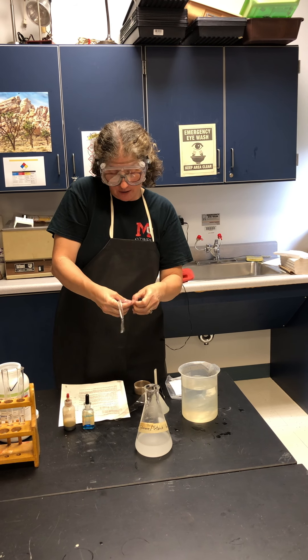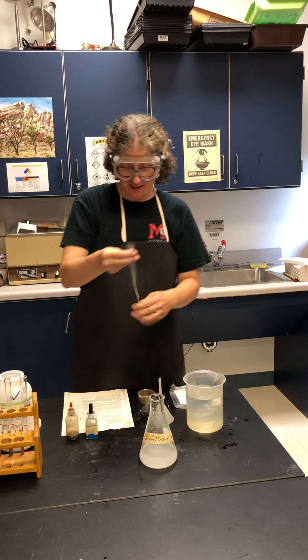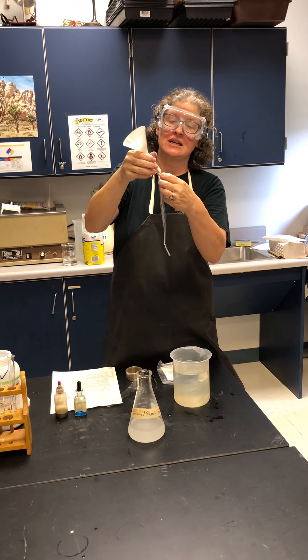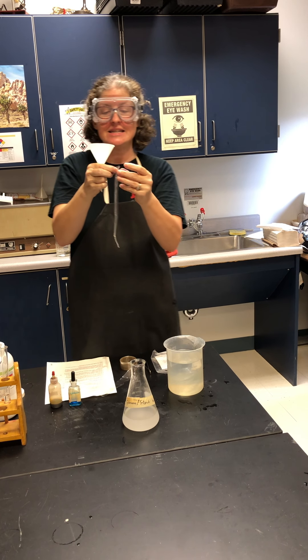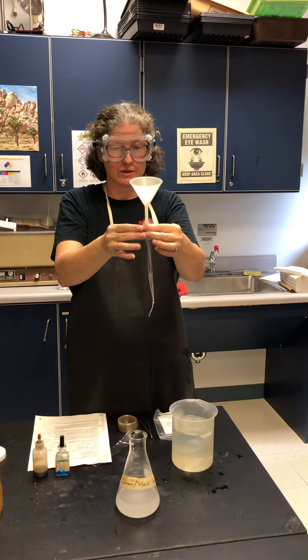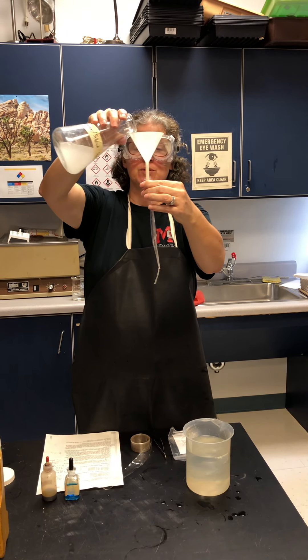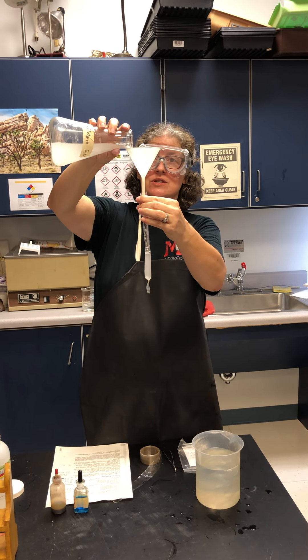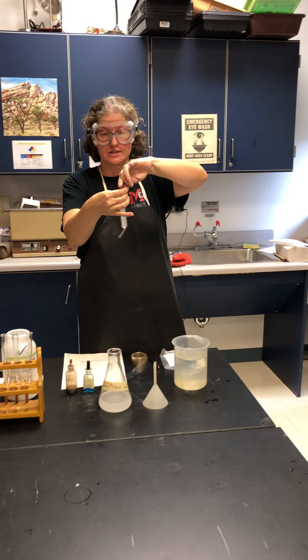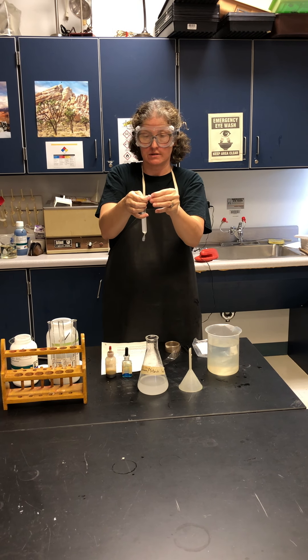To make the chamber, you knot one end first — never pour the solution in before you've firmly knotted the bottom. Then you take a plastic funnel and ease it into the opening at the top. Here is the glucose-starch solution I'm going to pour inside. I'm not measuring it because this is a qualitative study. Now we've got glucose and starch on the inside, and it is white and opaque.